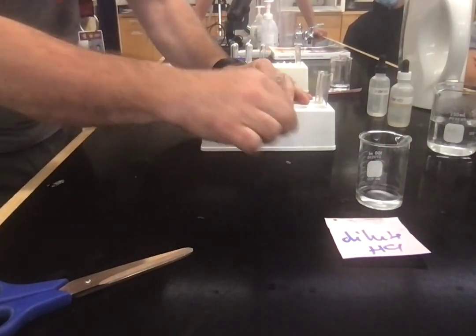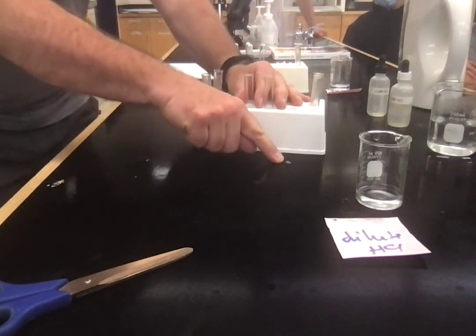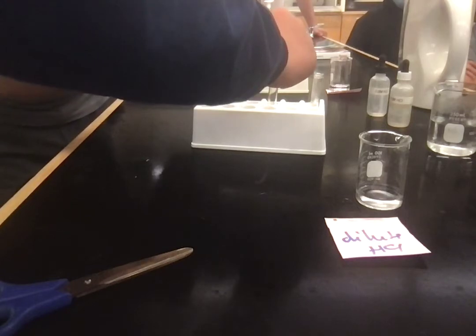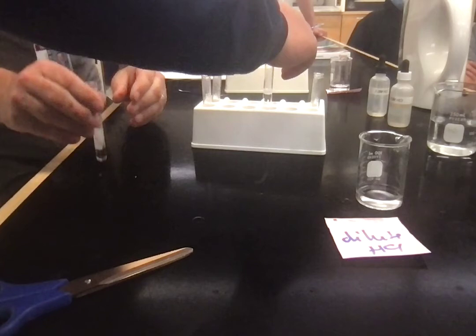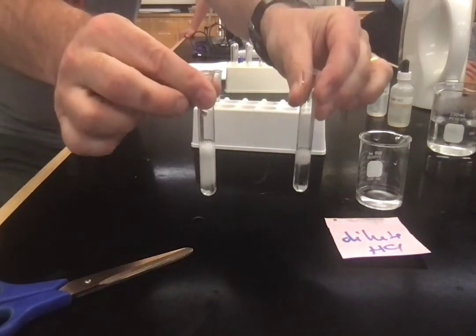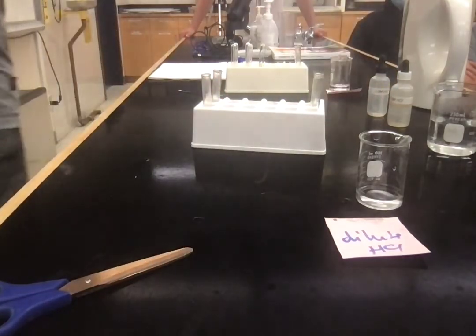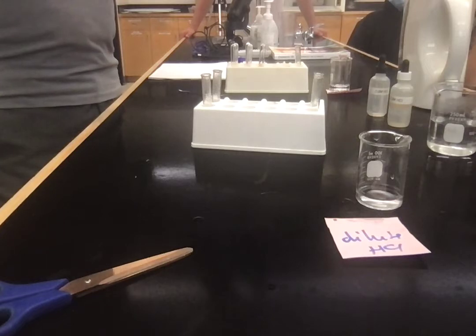We're going to have, right, this is where I might need a little bit of help. So, Nick, you're going to take that piece of magnesium and you're going to put it in this side. Sorry, this side. Okay. And at the same time, I'm going to do this with these. You ready? Go. Okay. Wow. Smaller ones are kind of floating around in the middle. Okay. This was not hot, so can we do a comparison?